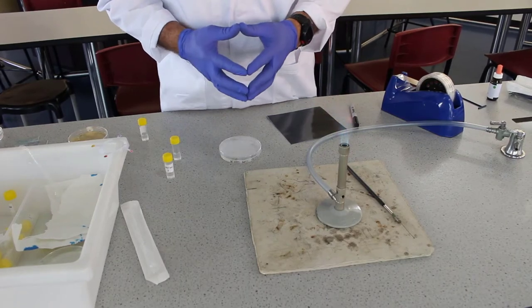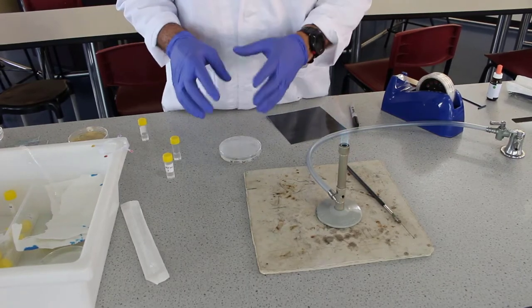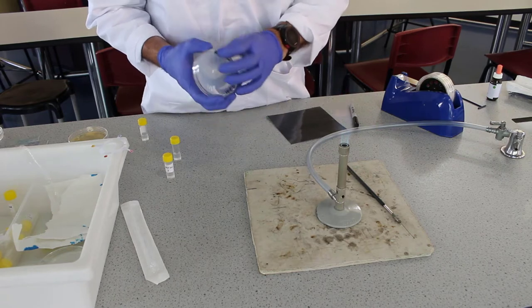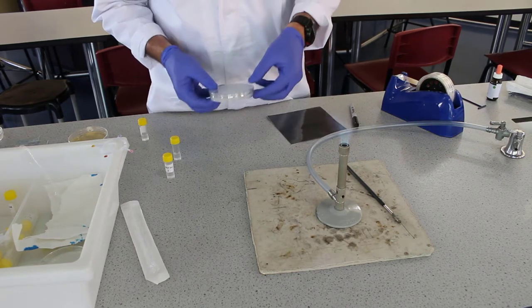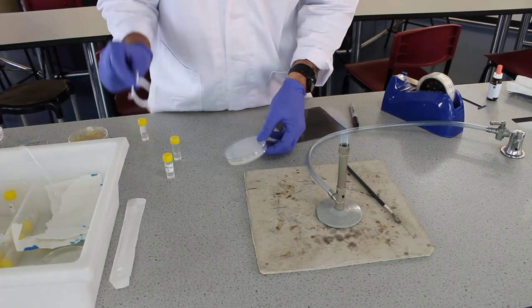In this video I'm going to show you how we can inoculate a plate to produce a bacterial lawn across the plate, and we do that so we can test our antibiotic rings.